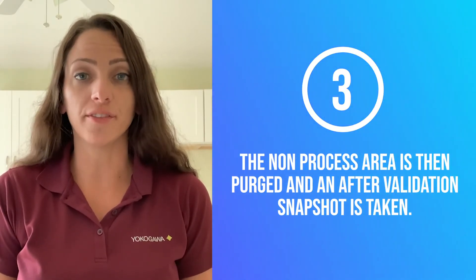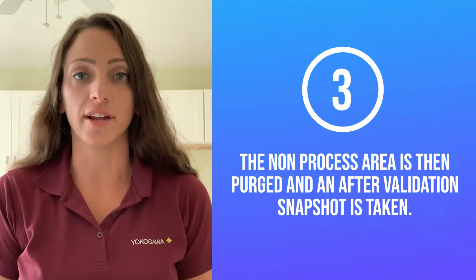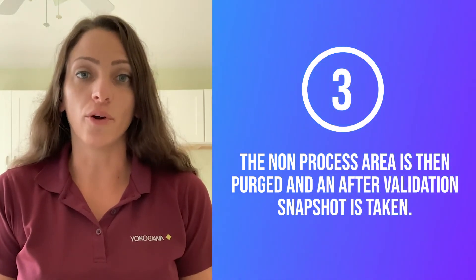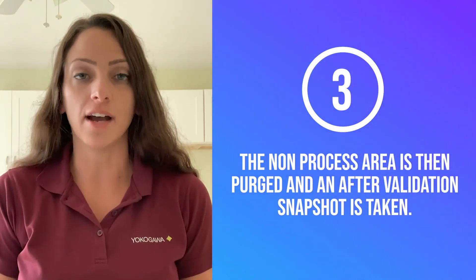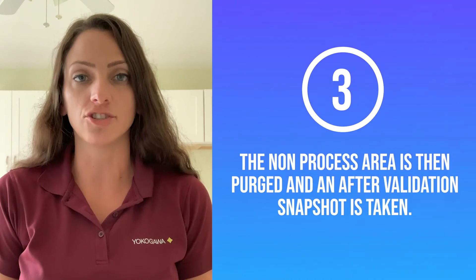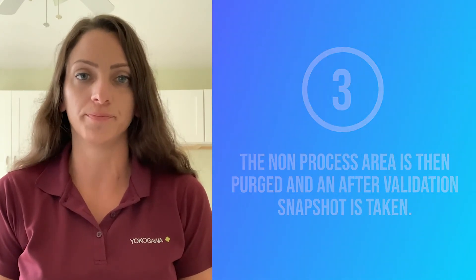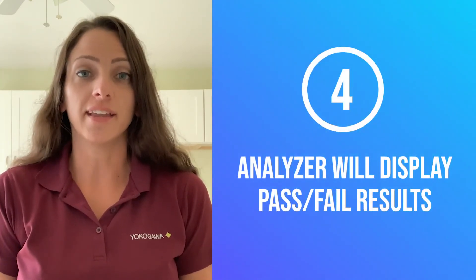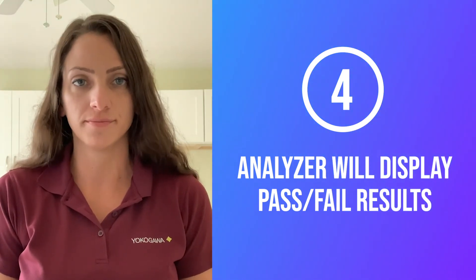It is important that the process is in steady operation during validation. If the before and after validation snapshots have too much deviation, validation will fail. Number four, the analyzer will display the pass or fail result.